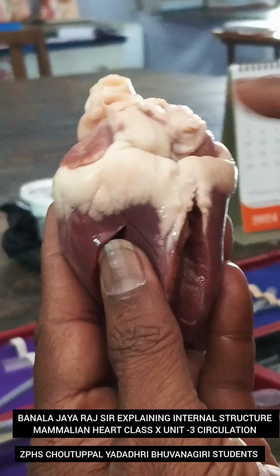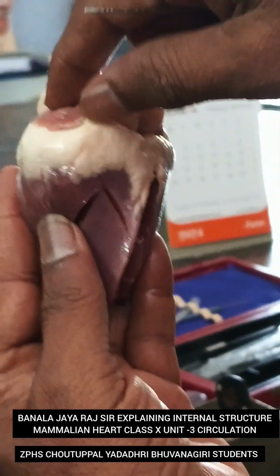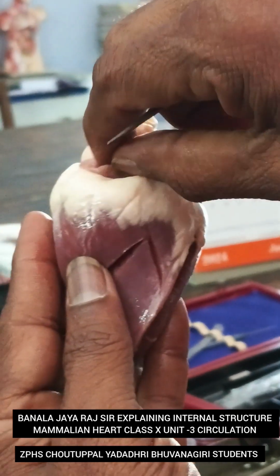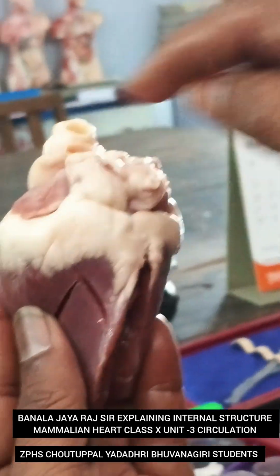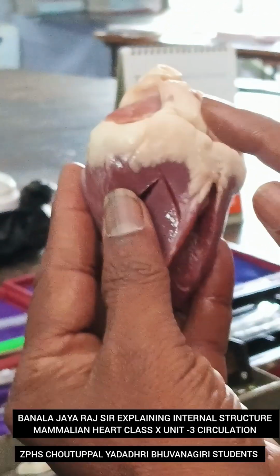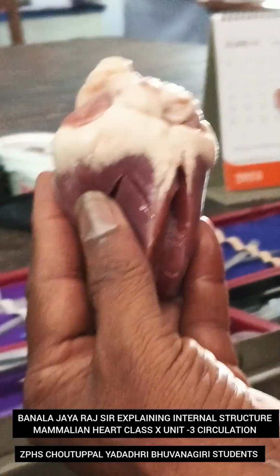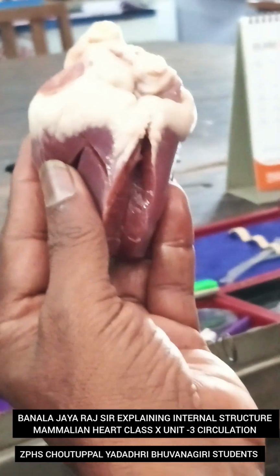This is the broad end and this is the conical end. This part is called the ventricles, and this is an auricle, and there is also another auricle. 2 auricles are there. Upper chambers are called auricles and lower chambers are called ventricles. How many chambers are there in the mammalian heart? 4. The heart pumps blood to body parts and receives blood from body parts.